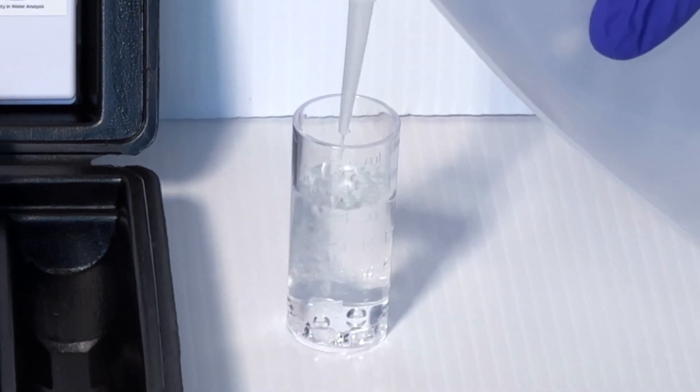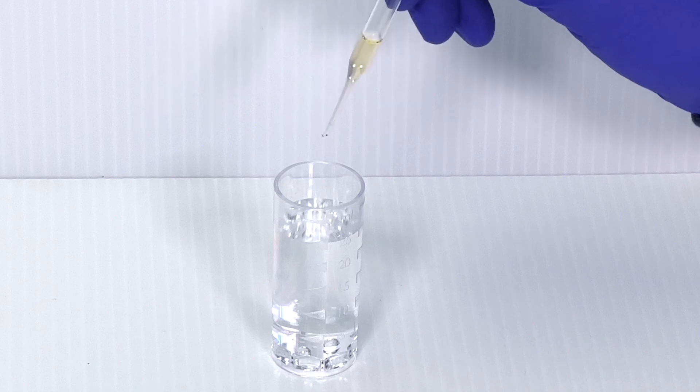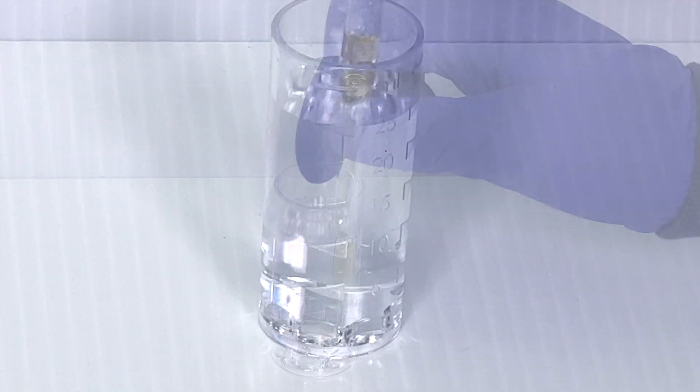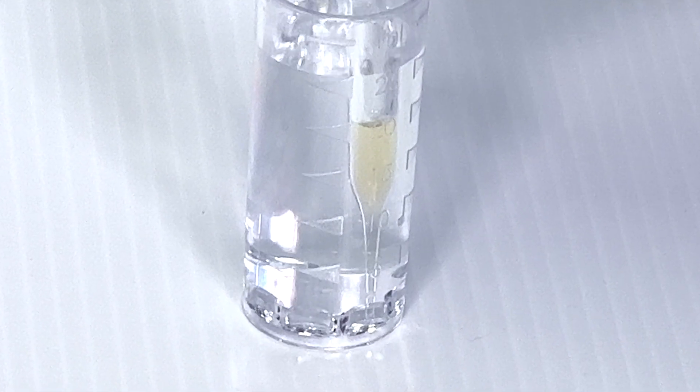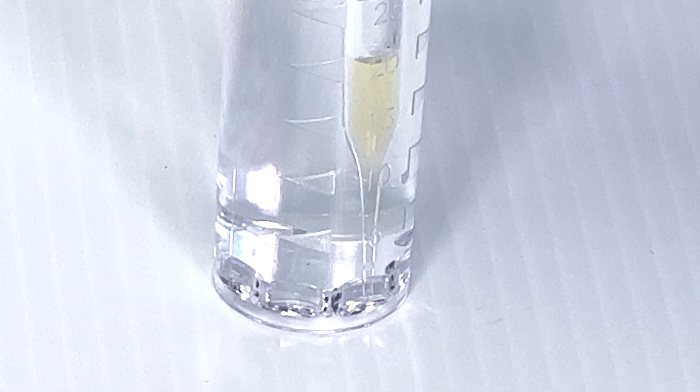After filling it with the sample to be tested, insert and fully submerge the ampoule tip down. Guide the tip so it seats into one of the notches.